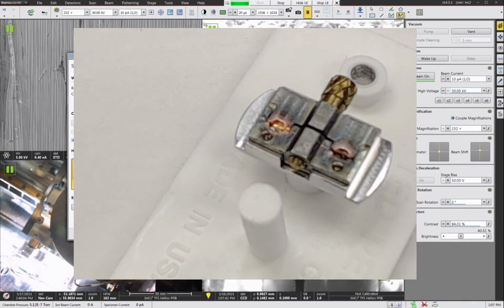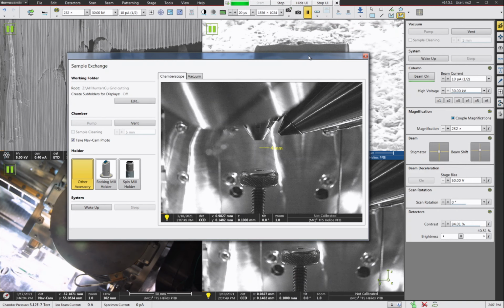And let's go ahead and put those into the microscope. So this is a Helios G4 PFIB. We're just going to go ahead and choose the other accessory for our sample holder right now. And we'll go ahead and hit click vent, and we'll vent the system. And I'm going to pause the recording so you don't have to wait for the venting time and the loading time. So we'll resume with the sample already in the chamber.